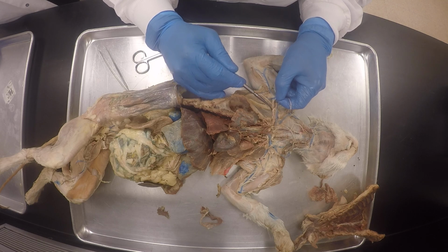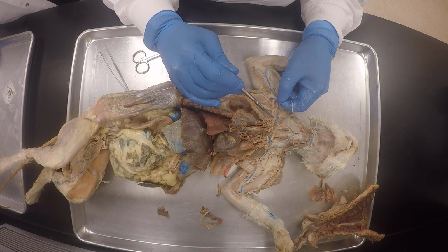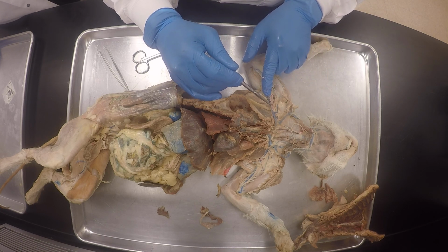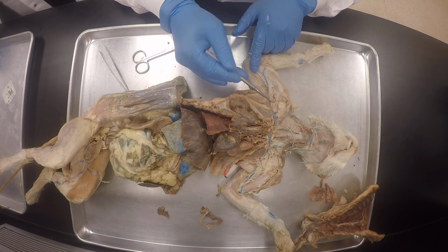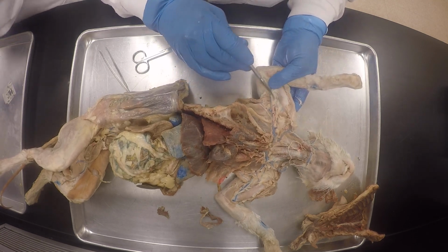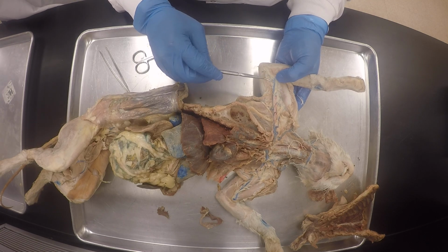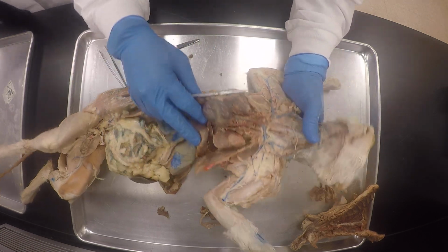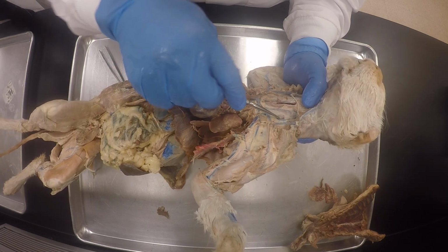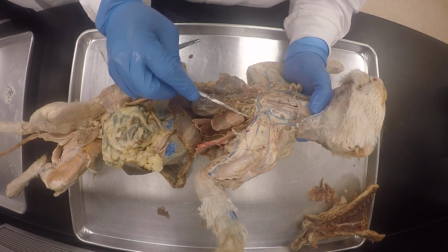And then the thyrocervical is going to kind of come somewhere here. And then here is still the right subclavian artery. And then after this, this becomes the axillary artery, right? And this is the subscapular artery. You understand? And then the brachial artery starts from here, going downwards, just like the brachial vein. Okay? I want to see the thyrocervical. The thyrocervical on the left is one we normally see. You understand? So it will give rise to the transverse scapular.